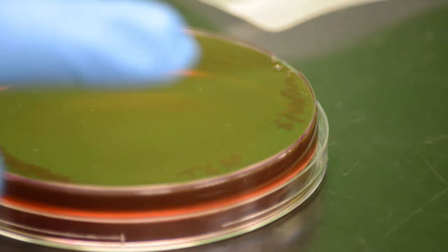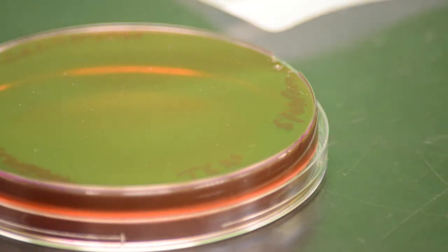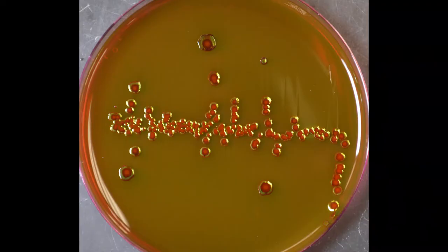In the box or incubator for your lab session. After 24 to 48 hours, the number of colonies on the surface of the agar can be counted. The approximate number of bacteria present in the original sample can then be calculated.